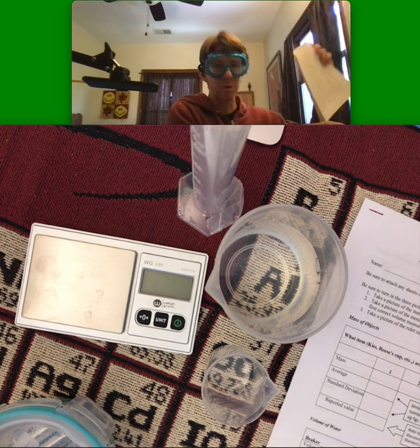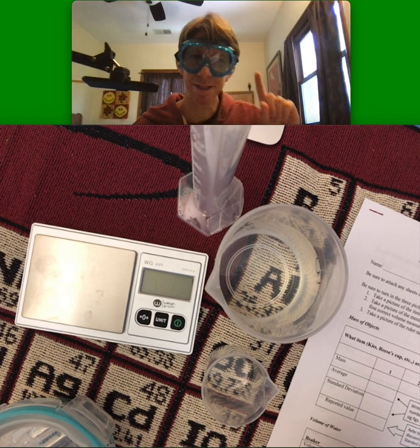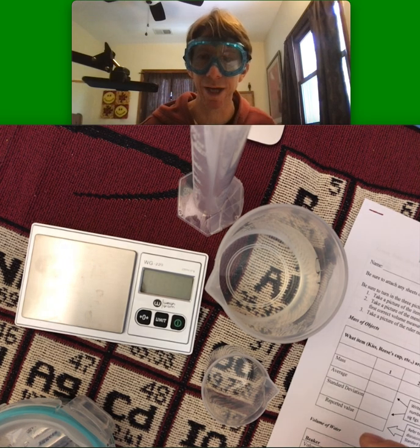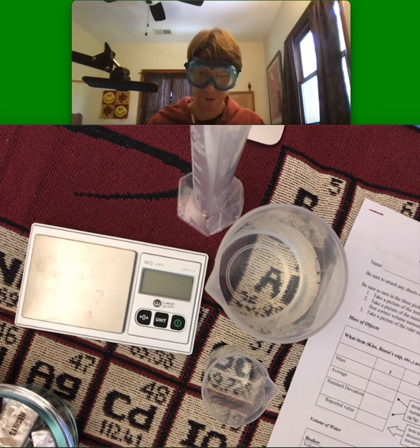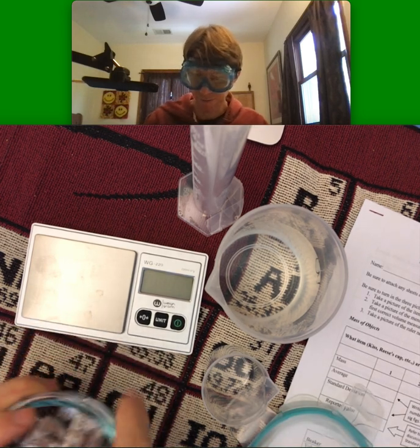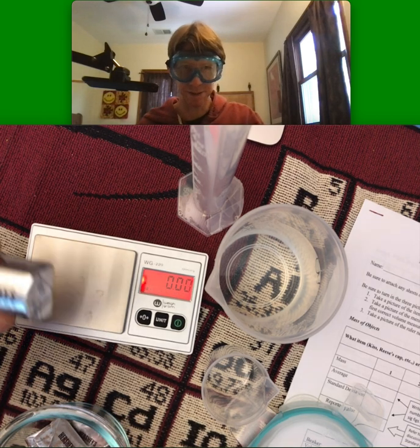If you flip to page four, it's got a list of the things that you'll need. It says under chemical samples that you need Hershey's Kisses, Reese's Peanut Butter Cups, or any other small and yet greater than two gram sample. I've got a variety of things that will work. I'm going to be using Hershey milk chocolate little tiny bars here.